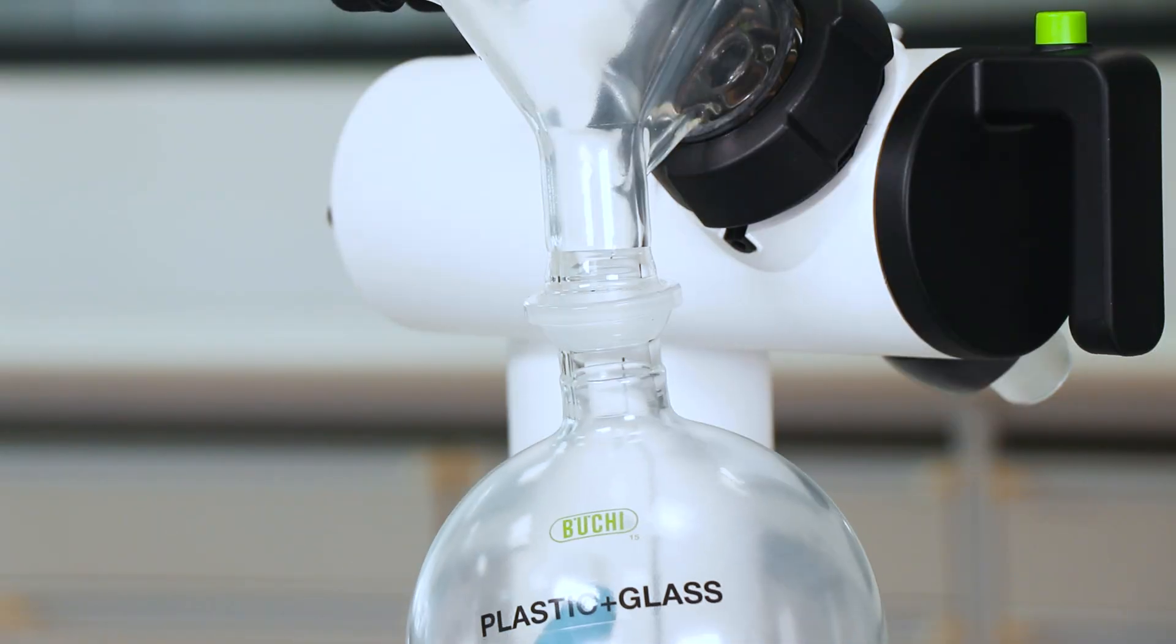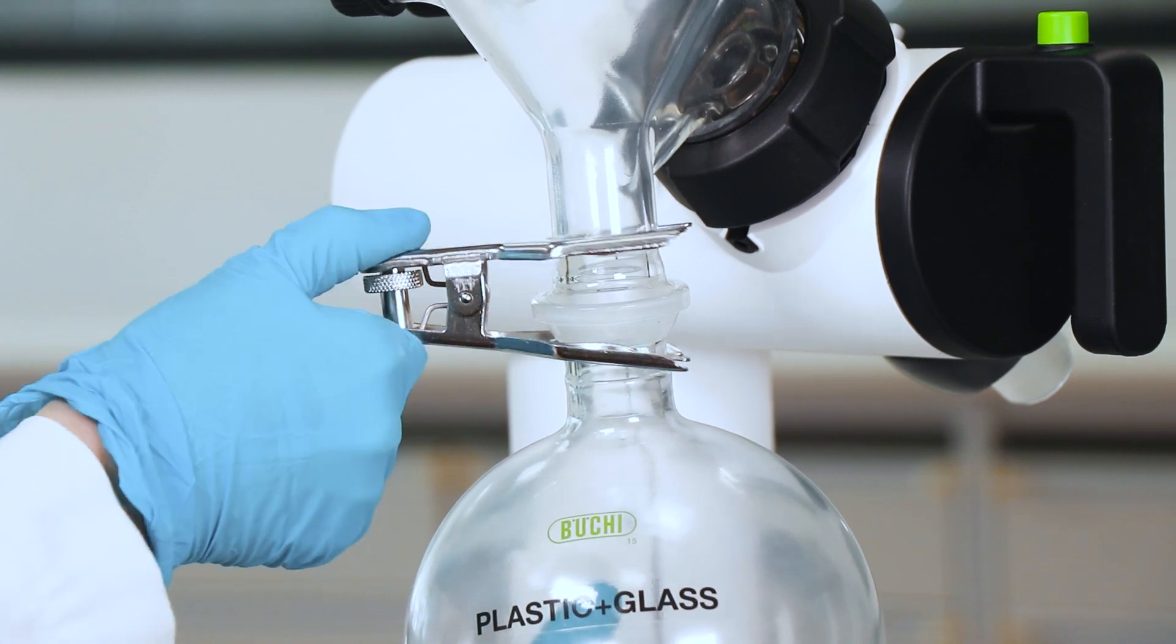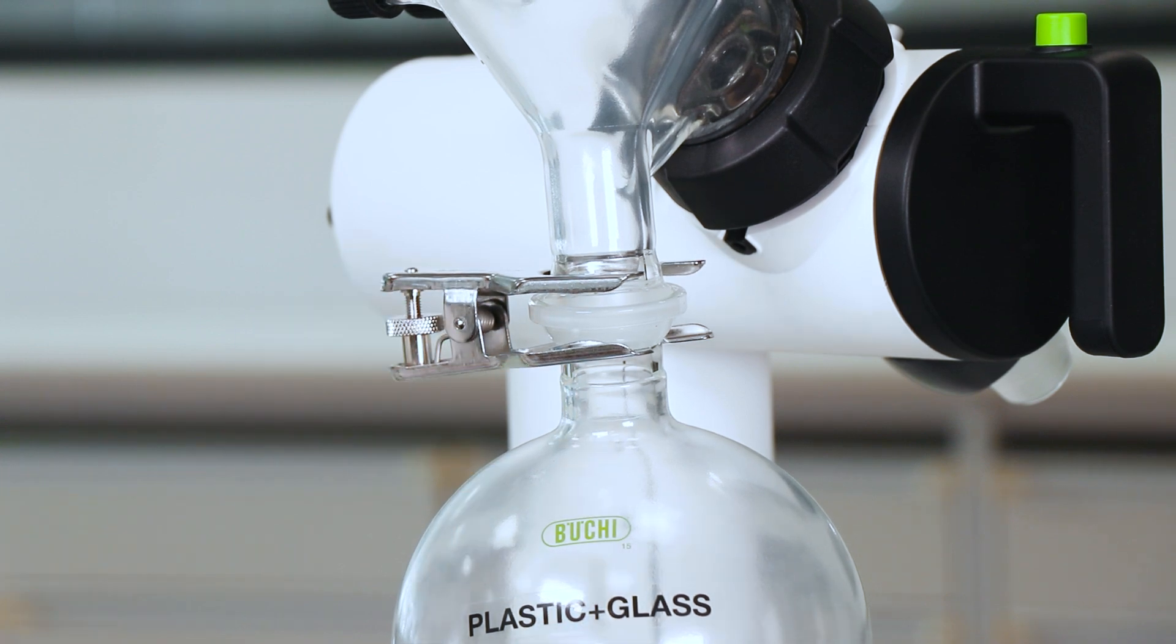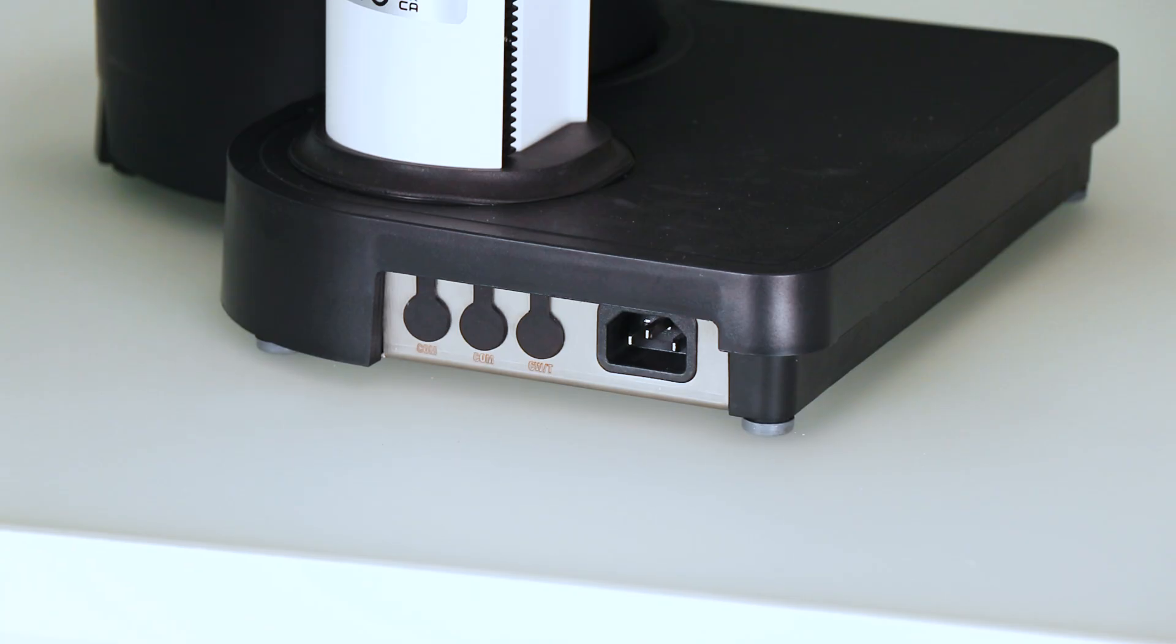So you just take the clamp and do it like this. So now you just connect the instrument to the power.